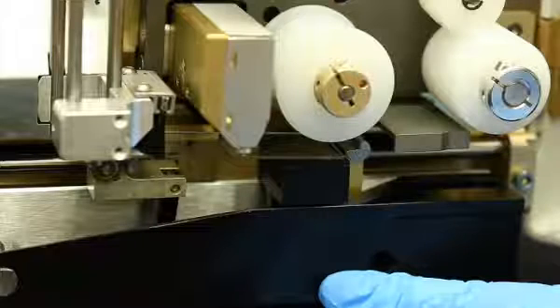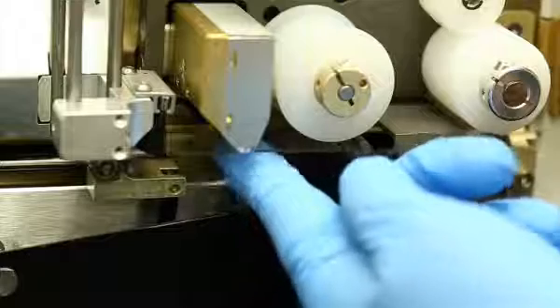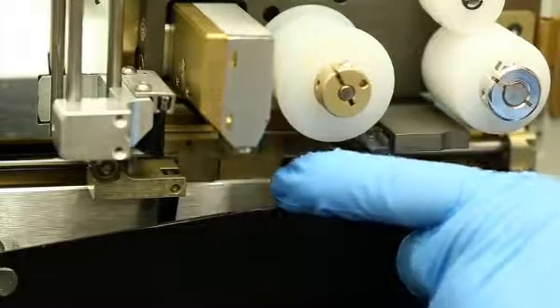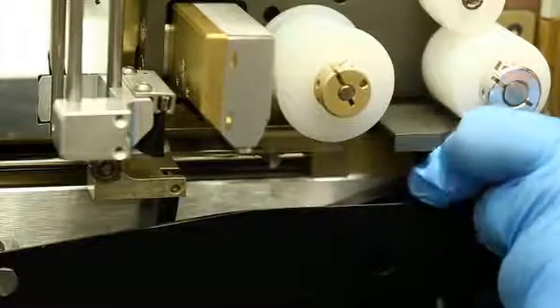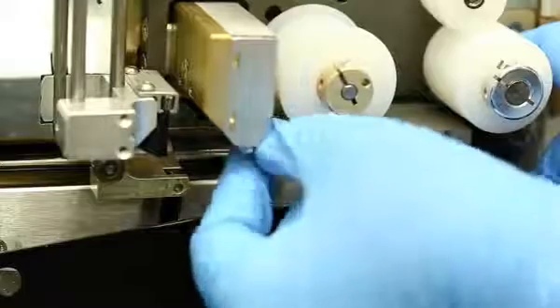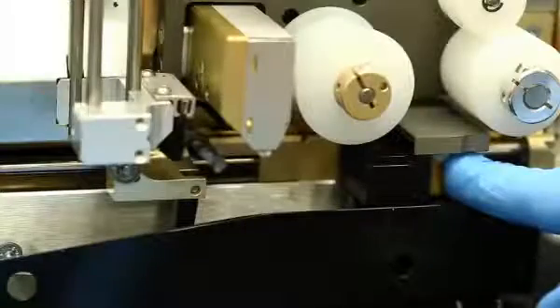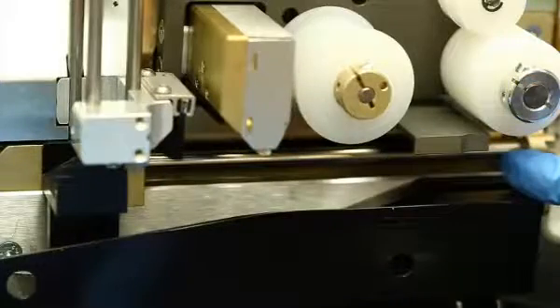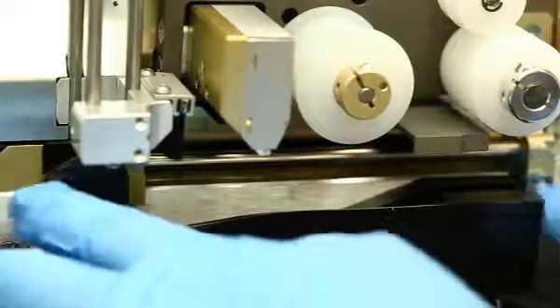Step 4. If the slide moves slightly but does not have enough room to come clear, it may be necessary to push the parts that normally carry the slide handling mechanism, left or right. To move to the left, press the black plastic part in to the left. To move to the right, press the roller part in to the right.